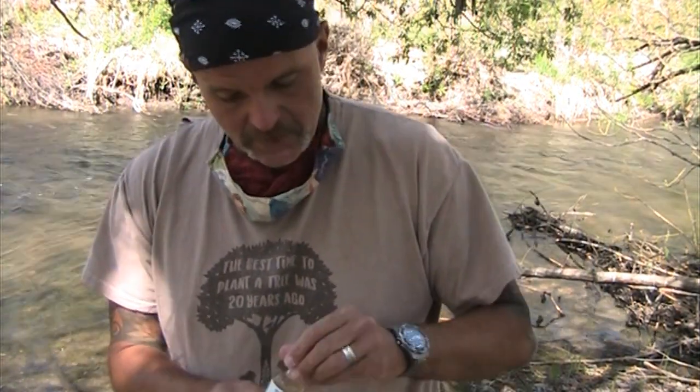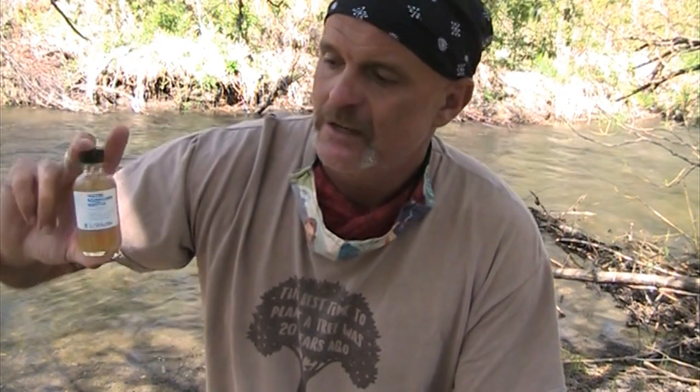And yes, I used to do this at the research lab. My research lab was on a boat. At this point, they can finally shake it. So you can shake it. Does not need to be shaken like a martini. And then you have to get the students to put the bottle down.